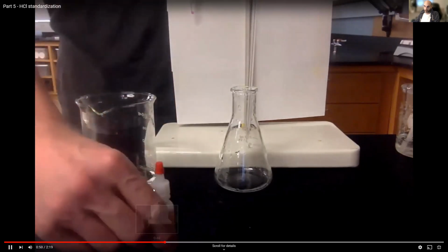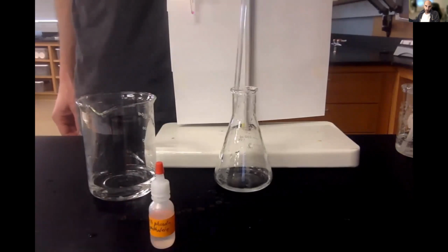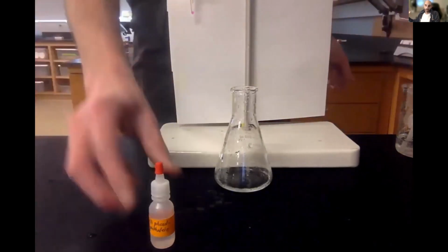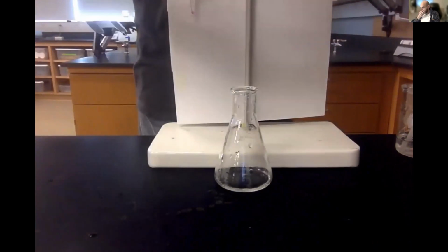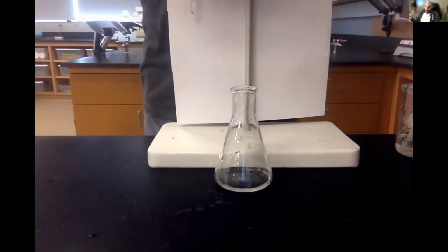Okay. This is my phenolphthalein indicator. As soon as all of this comes in, I'm going to add a couple of drops of phenolphthalein indicator. That's going to turn pink when we have reached the endpoint, or when we have an equal reaction. So I'm going to add 2 or 3 drops. Ultimately, it doesn't matter, just a couple. There we go. I'll mix it up, and I'll get my titration set up.